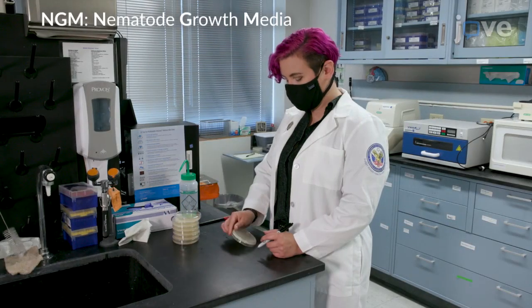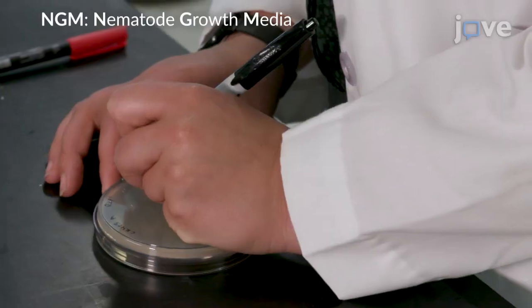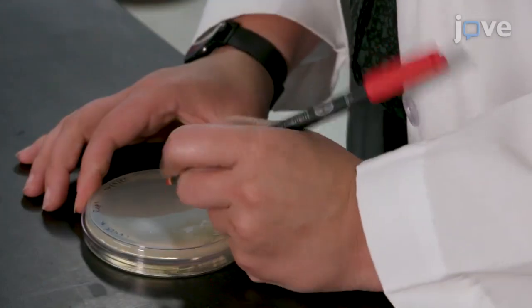Flip the NGM assay plates upside down and label the bottom with an identifier for the C. elegans strains to be assayed. Make a small dot with the marker in the center of the upside-down plate.